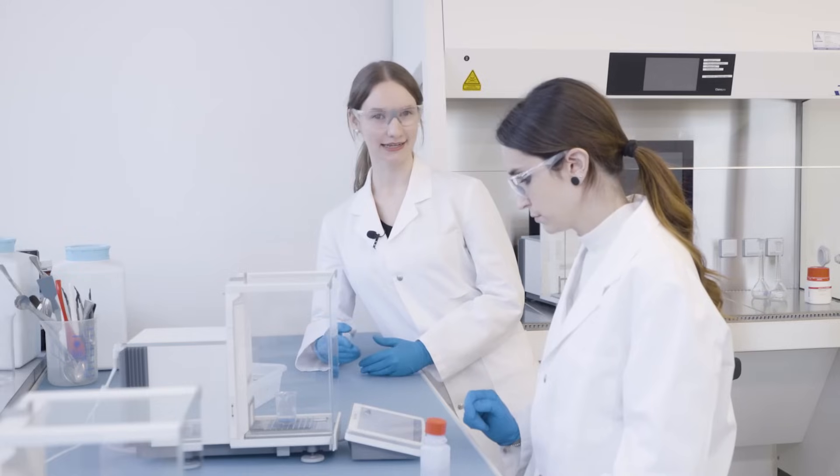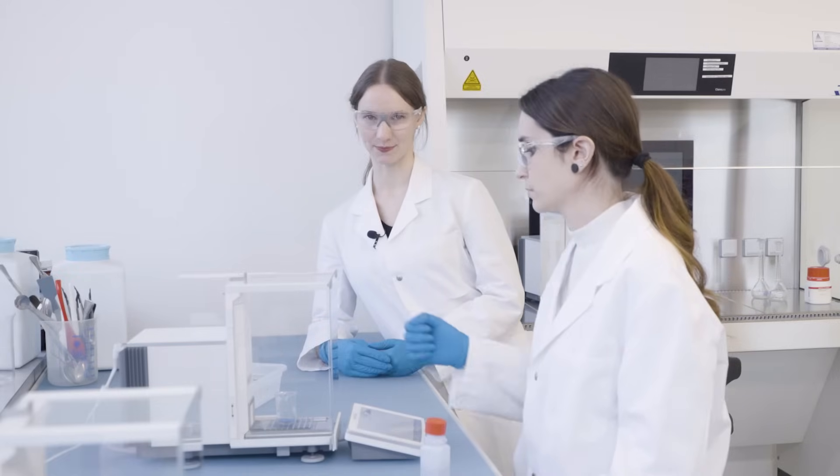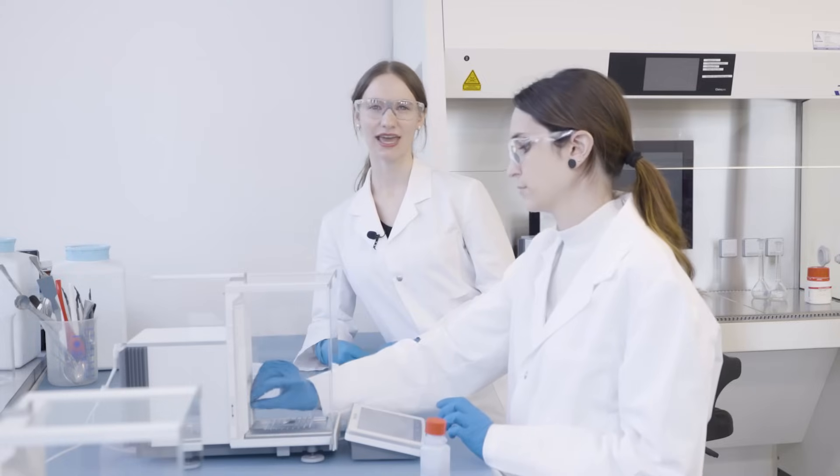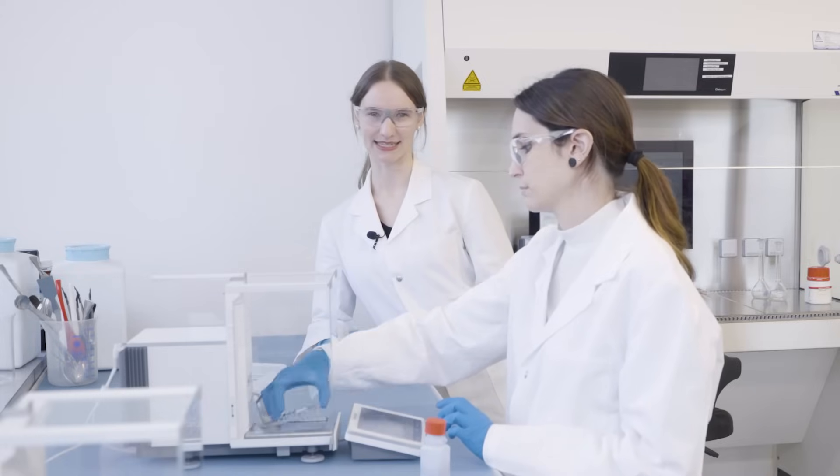Speaking of cleaning, cleaning the XPR is really simple. The weighing pan can be released by one push and the draft shield dismantles in seconds.